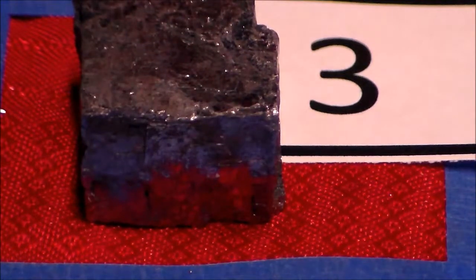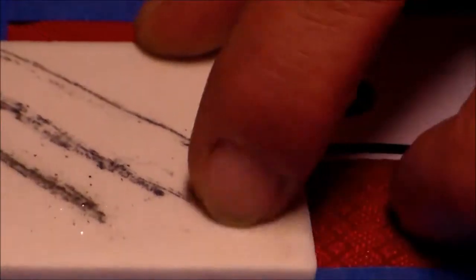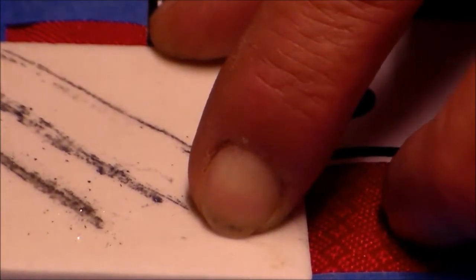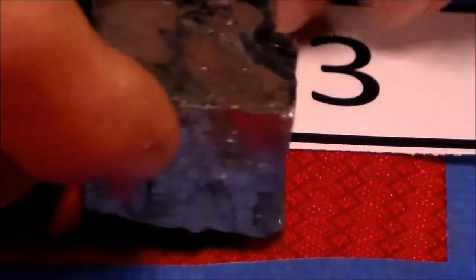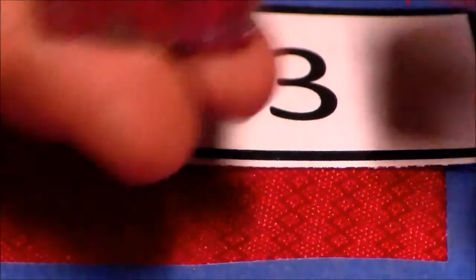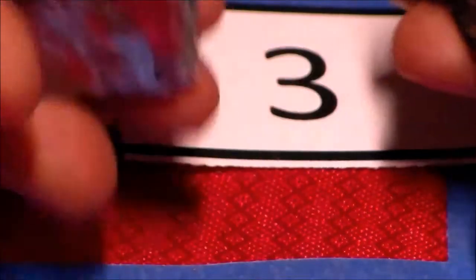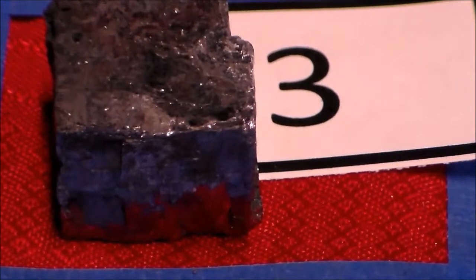Now we've got to determine some other properties that help us identify it. So if we look back to the streaks on the streak plate, this one was where I streaked it here in the center. It's got a gray to a kind of grayish black streak. It's kind of a light gray color, very shiny. It's very heavy compared to the other ones that are about the same size, and I know you can't feel this, but you'll have to take my word for it. Compared to this one, it is very heavy. So that would mean it has a higher specific gravity.